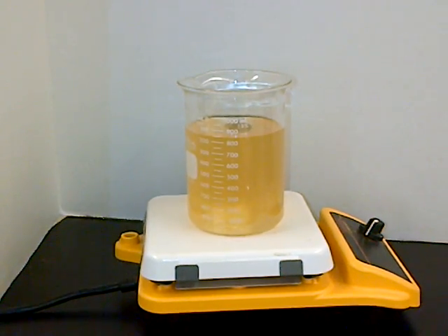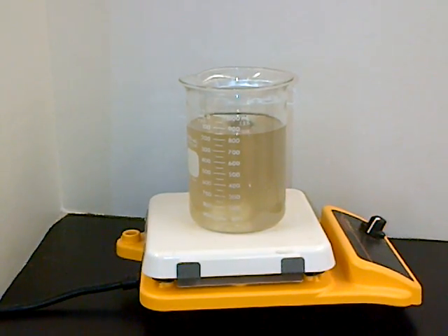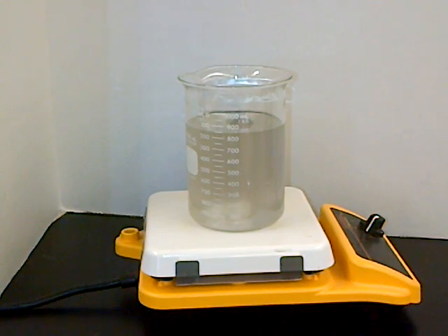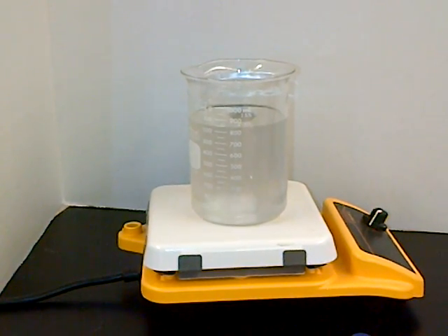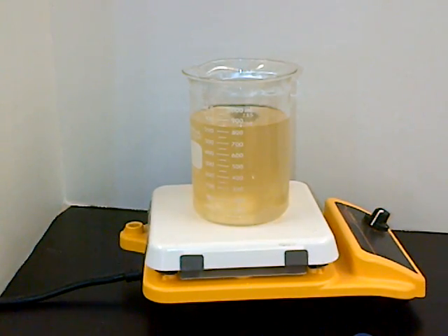Did you see the differentiation in the colors? You can see that it oscillates, right? So what's happening — we've done this — the reactants went to products, right?